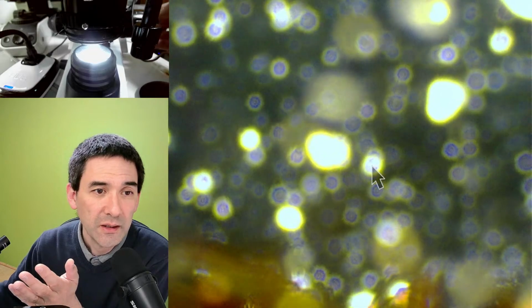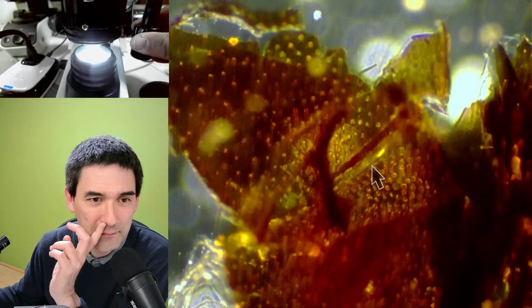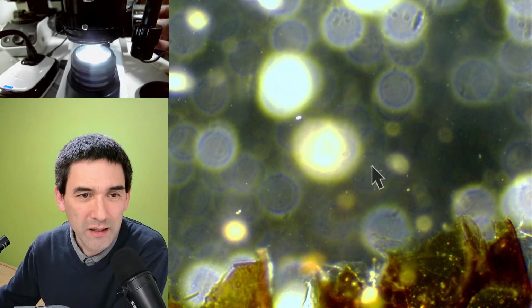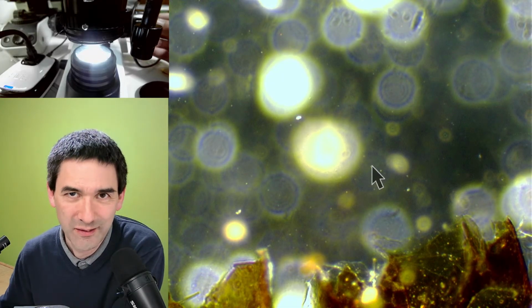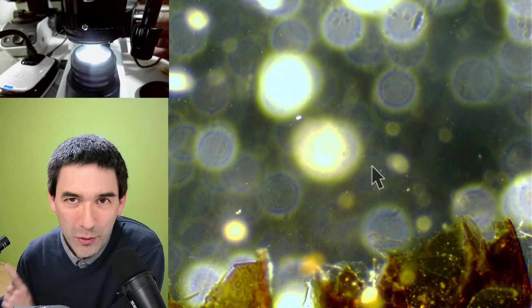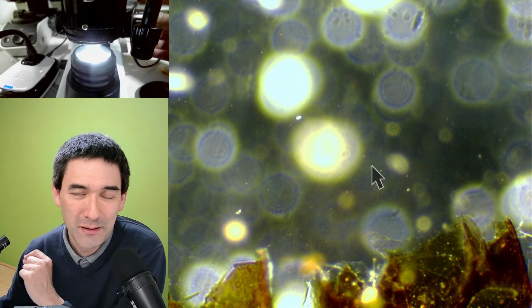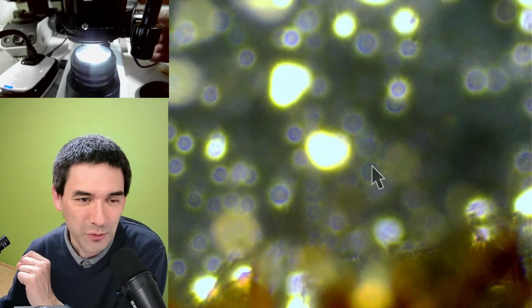There is now something really interesting that I need to tell you. It's a little bit counterintuitive, but it's really fascinating. Because dark field, like we've got over here, increases the contrast so much, it is, you gotta hear me out here, it is possible to see structures that are below the resolution limit. However, you're not able to see any details, so you're not violating the limits of resolution or physics.